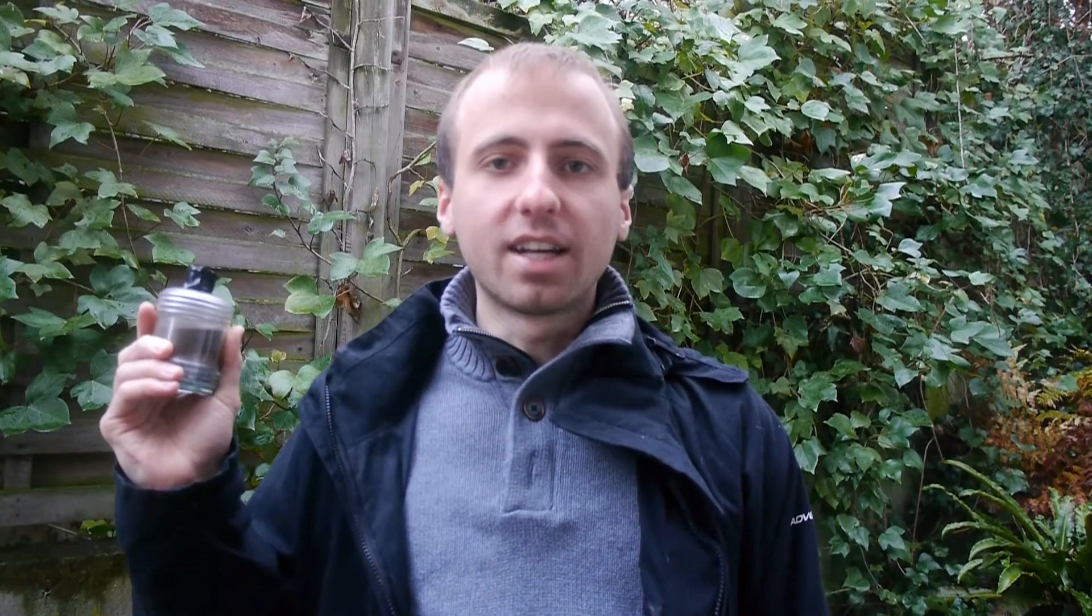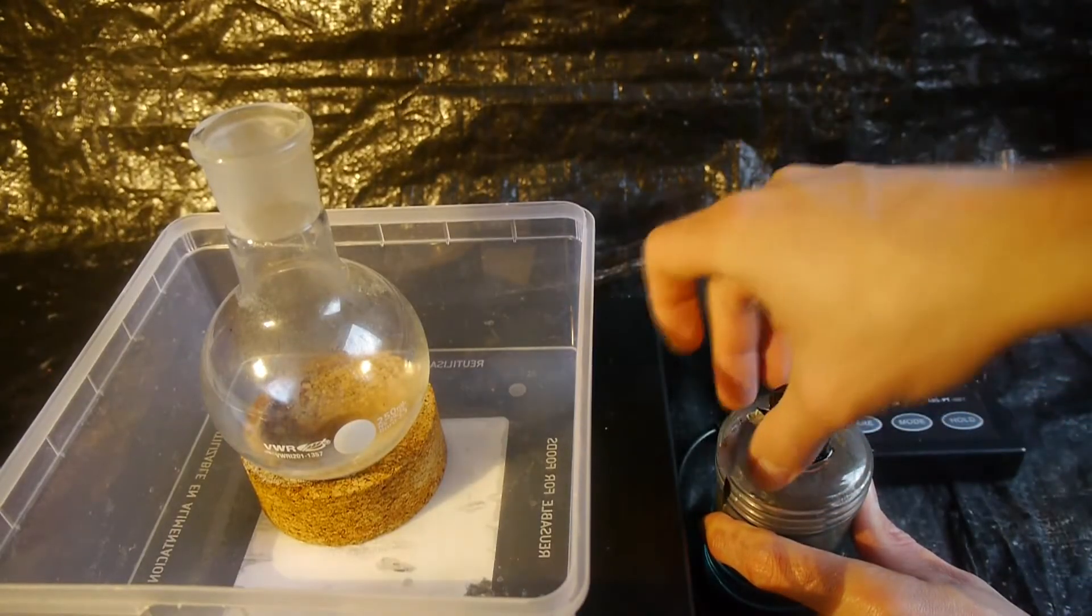This is probably the most dangerous thing I've ever done on this channel, so fingers crossed that nothing goes wrong. Also, please refrain from repeating anything you see in this video at home. Now let's start by opening the flask.